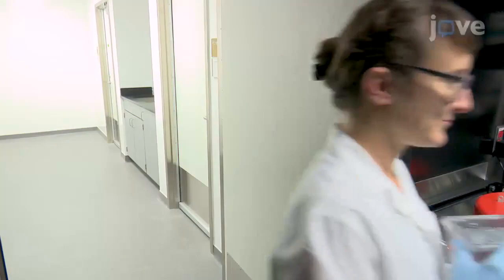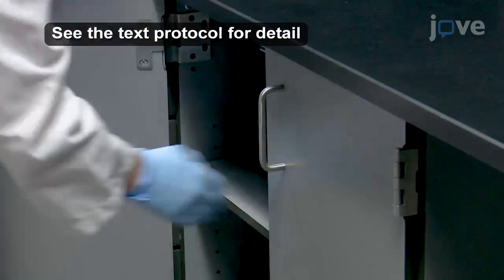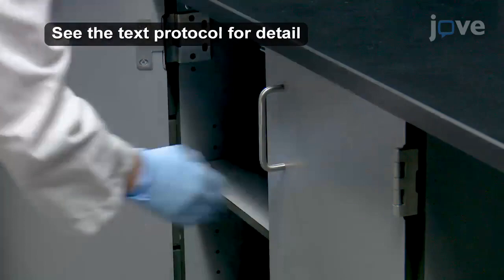To make it possible to remove the retinal pigment epithelium, or RPE, from the zebrafish, dark adapt the fish for one hour prior to making tissue slices.